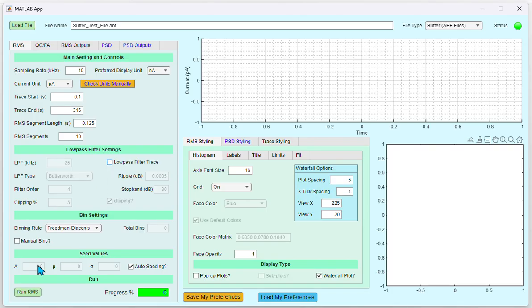Various binning rules are available under bin settings. There are a total of 5 binning options as seen in the drop-down menu. If you want to manually set the bins, click the Manual Bins radio button and you can set the number of bins in the Total Bins field. The seed values are the values that would be used as initial guesses of the Gaussian fitting. By default, auto seeding is enabled. If for some reason these seed values are not suitable, you could enter them manually by clicking the auto seed, which would enable the A, mu, and sigma edit fields, where A stands for the pre-exponential factor, mu is the mean, and sigma is the standard deviation.